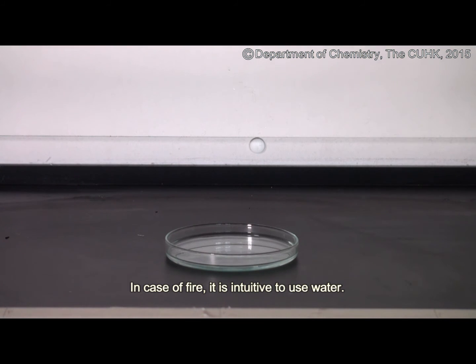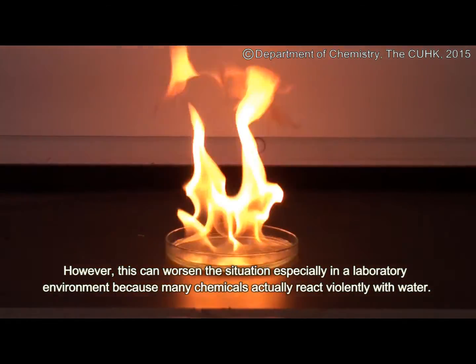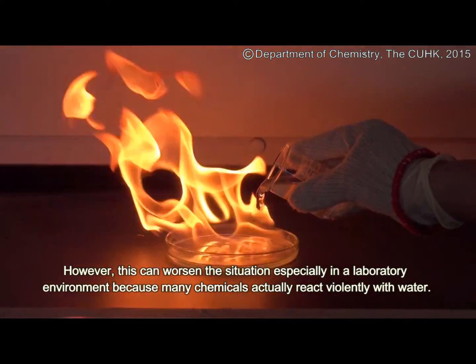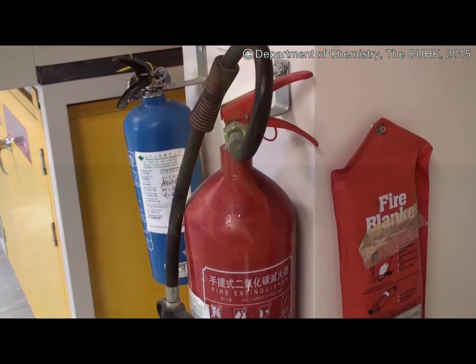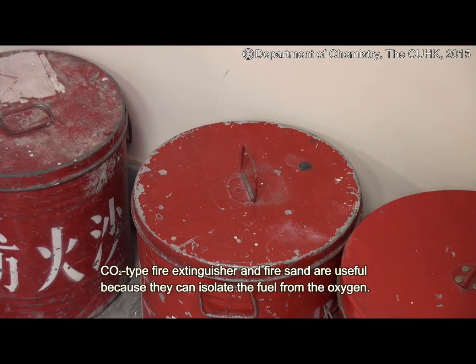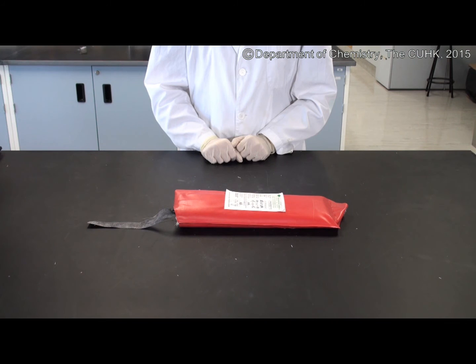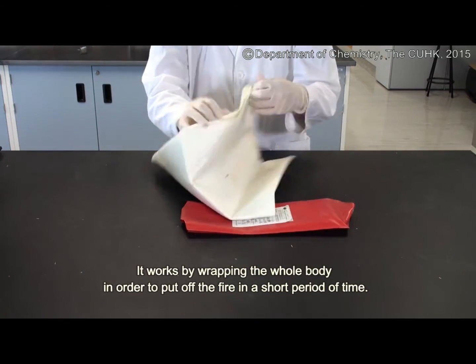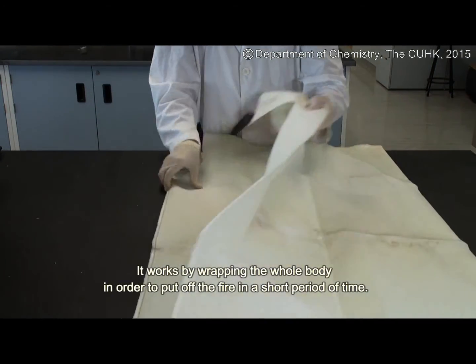In case of fire, it is intuitive to use water. However, this can worsen the situation especially in a laboratory environment, because many chemicals actually react violently with water. CO2 type fire extinguishers and fire sand are useful because they can isolate the fuel from the oxygen. A fire blanket is used when an individual catches fire; it works by wrapping the whole body in order to put off the fire in a short period of time.